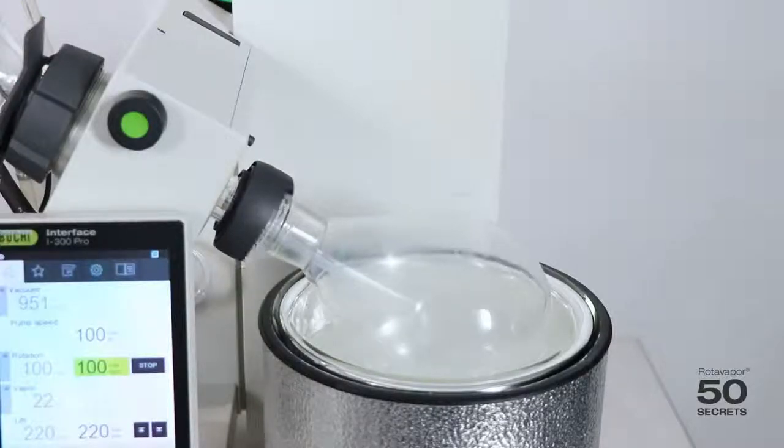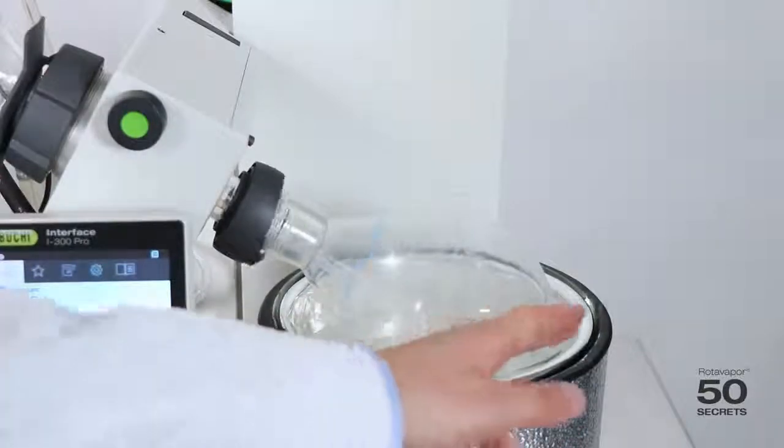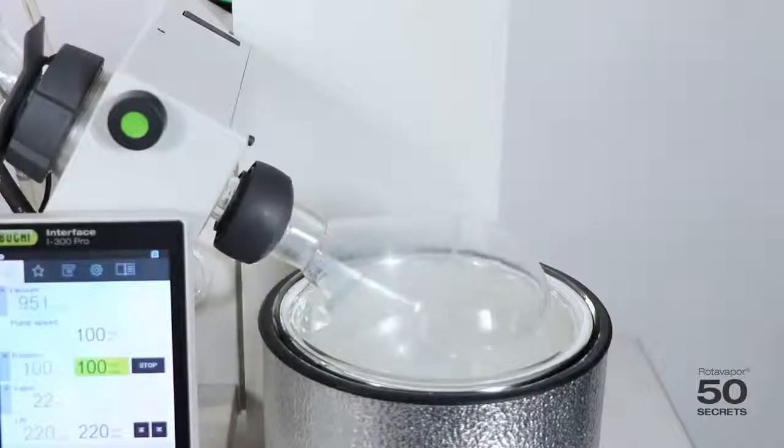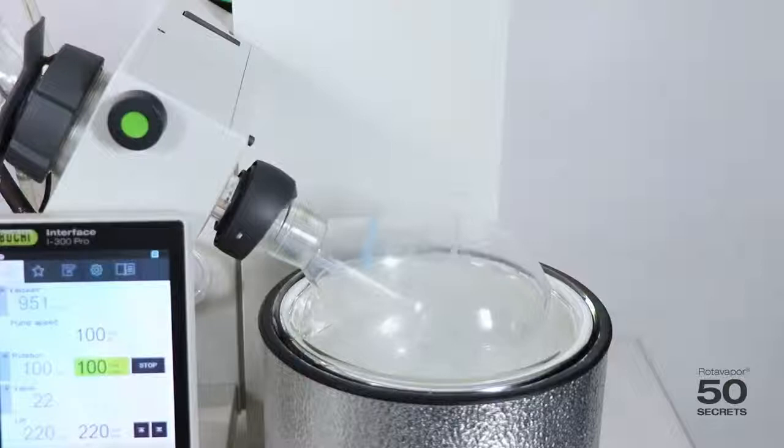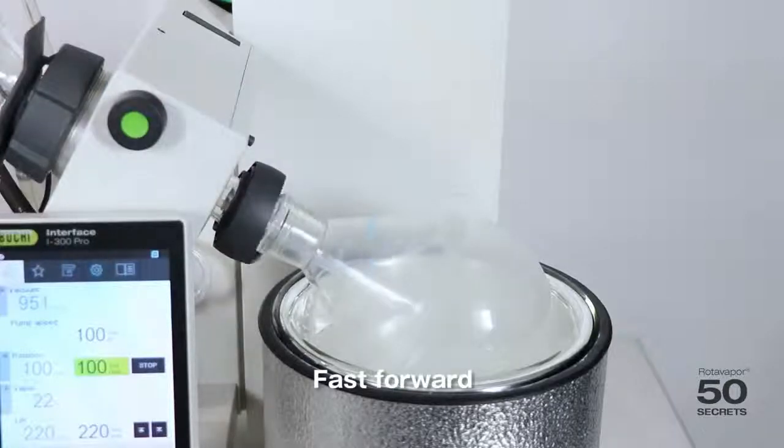The freezing process starts, and we will see ice which is built inside the flask, on the walls of the flask. The freezing process of each sample takes about 5 to 10 minutes.